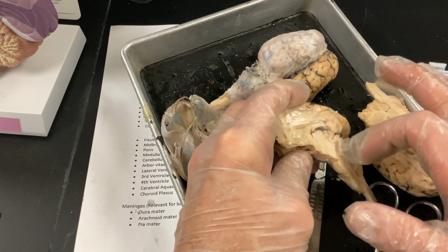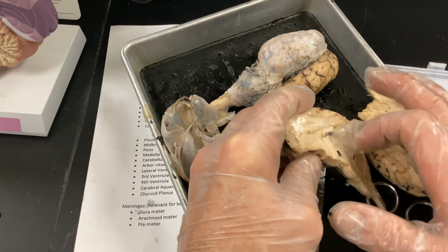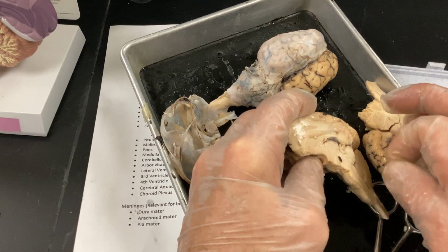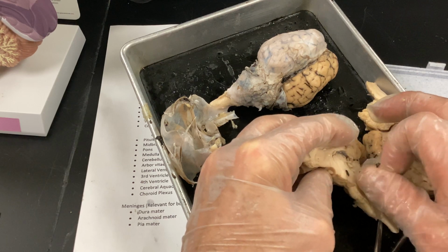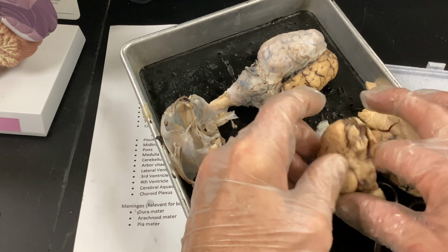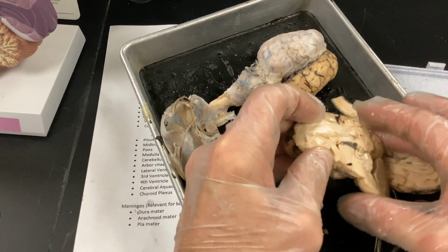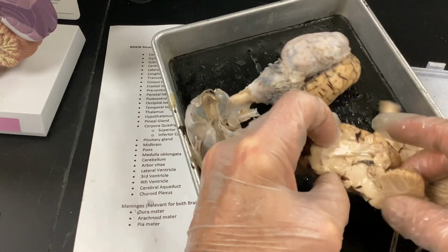And then out here, where my finger is, not quite to the cortex, is going to be your paleo mammalian part of your brain. So a little bit more involved. It's going to really involve your limbic system. And remember, your limbic system was your emotions, how you react to things, the amygdala for fear, and things like that. Your insula would be deep to this. Sorry, we'd have to cut that away for the parts of digestion. But that's really more of your slightly more advanced part of your brain.